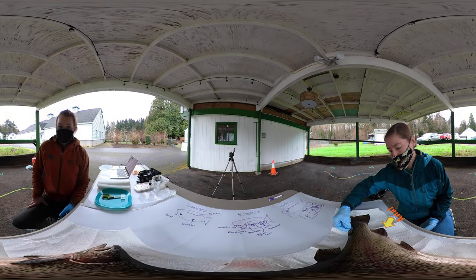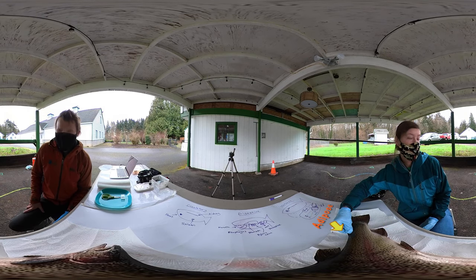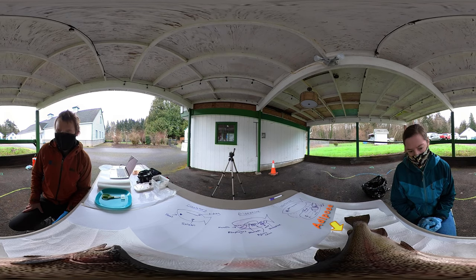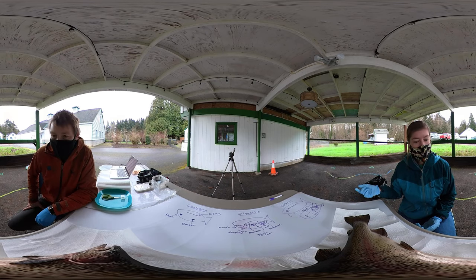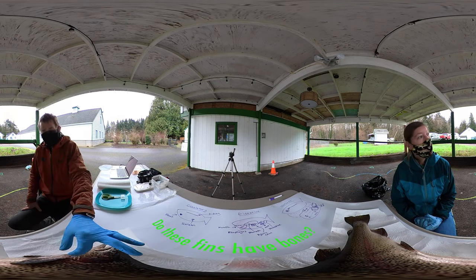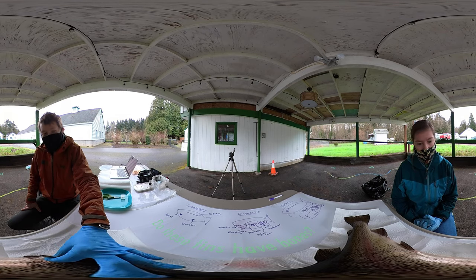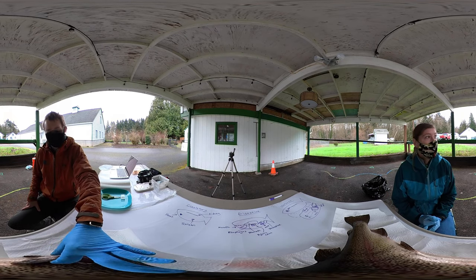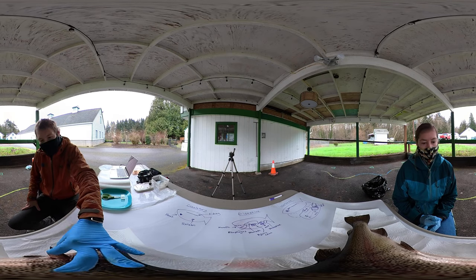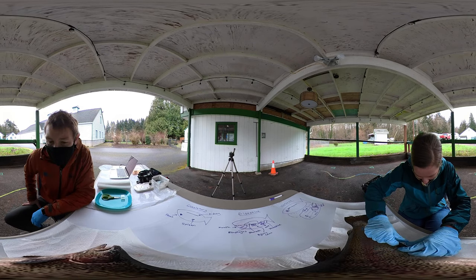This one's really neat. This one is the adipose fin. Some people call this one the hatchery fin too. So I've got a question for you — we just looked at all of these different fins, but Andy, do you think that these fins have bones inside of them? That is a great question. I'm going to guess maybe? They feel a little hard. There's definitely some rigid structure in there, but it doesn't quite feel like bones — it's kind of see-through. They're kind of flimsy but also kind of hard.